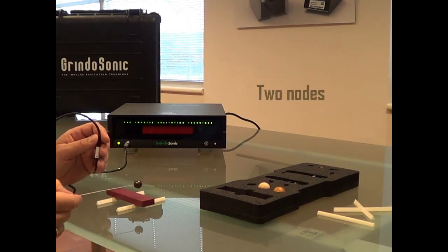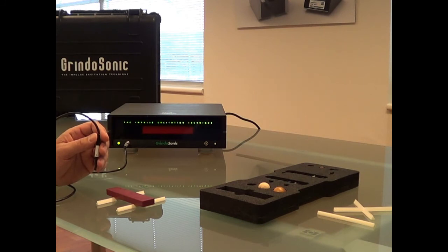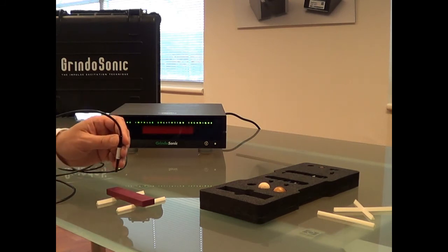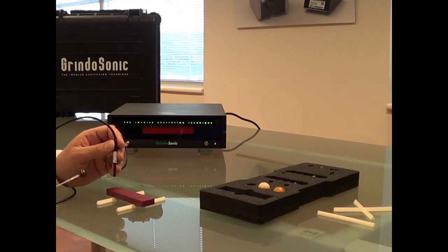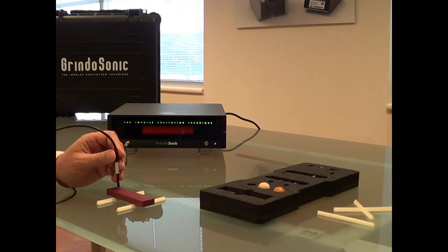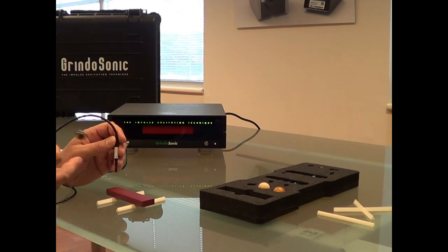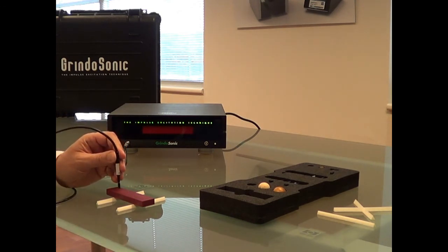We've supported it in the two nodes that are the places where there's minimal vibration, and we've supported the bar in those places in order not to disturb the own vibration modes of the ceramic bar.